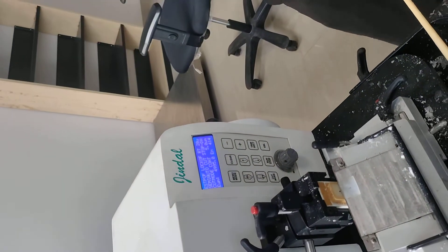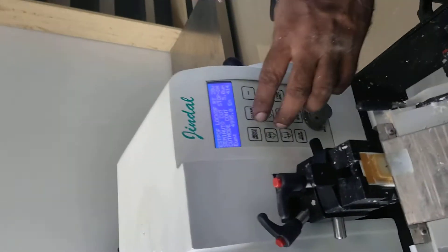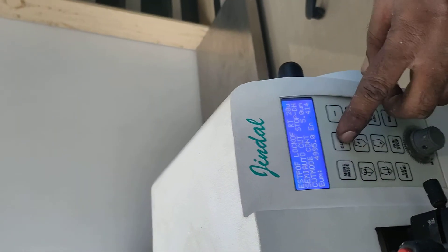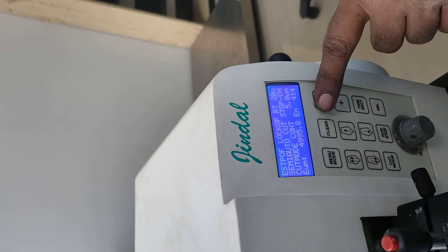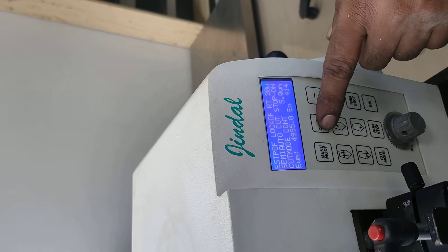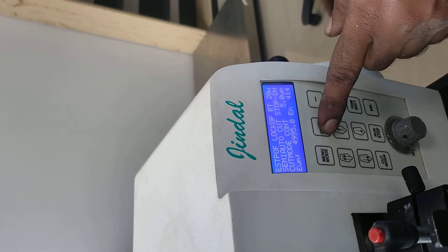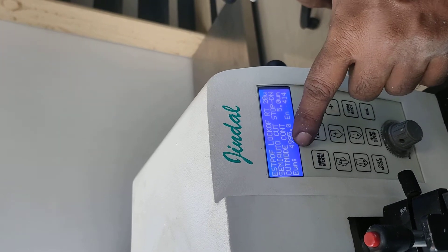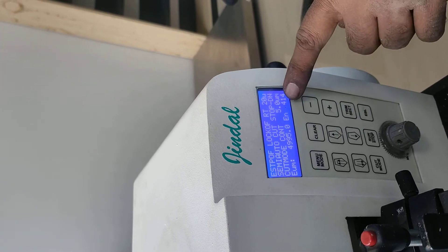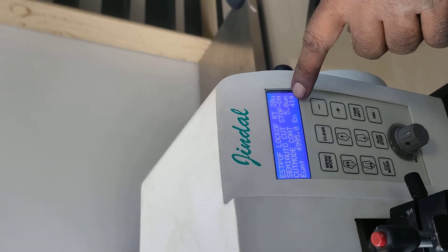So if we look into the menu, you can see the menu mode. The menu mode is for it, because this is what you are getting. How can you do the factory reset? You can do the factory reset — you can do the setting and put the button on your own. In this one, there are numbers of microns and numbers of cuts. How much cut is it? Now it is 414.